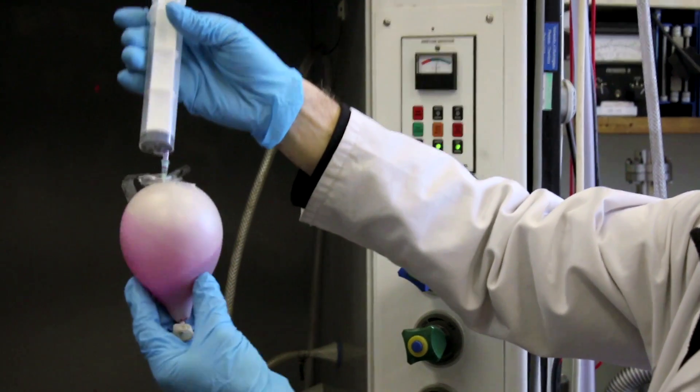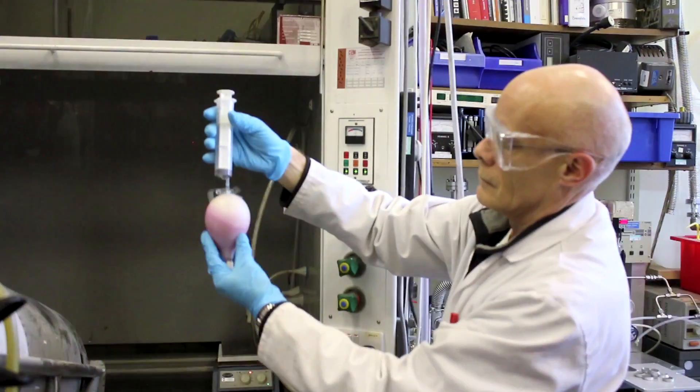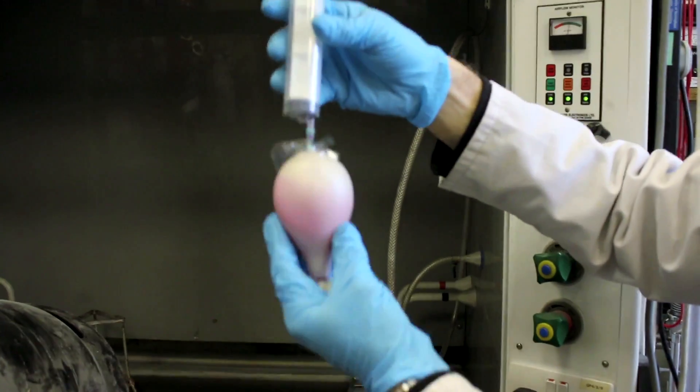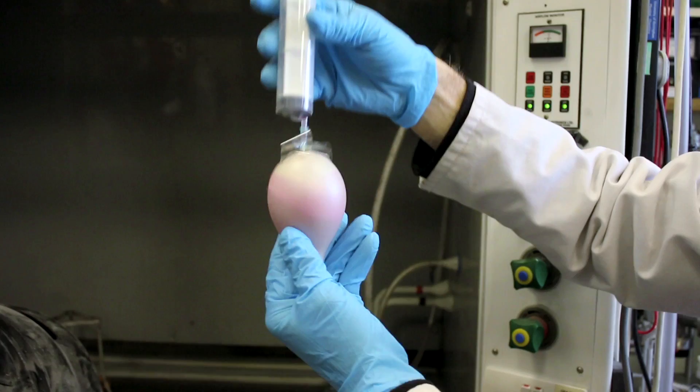However, he managed to hang on till the balloon went from this sort of size to about the size of my clasped hands. We were all really very pleased. In a way, it's a nicer demonstration to show how the gas is disappearing into the liquid than the traditional ammonia fountain.